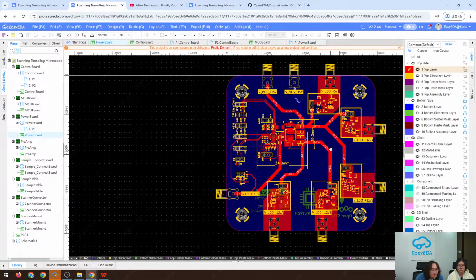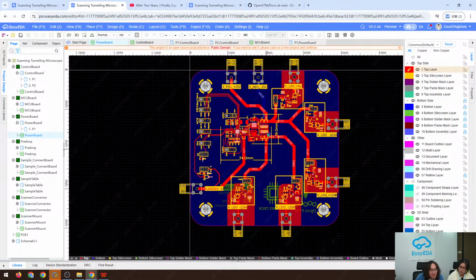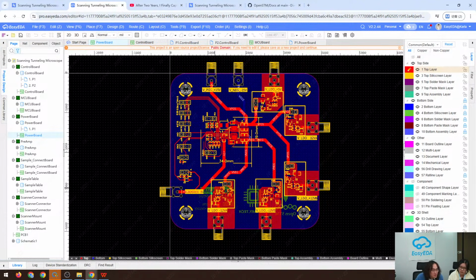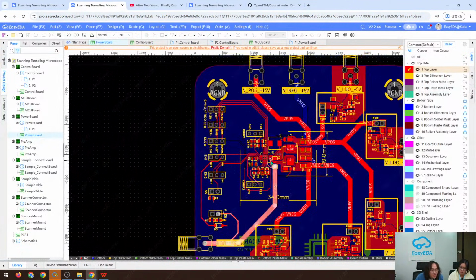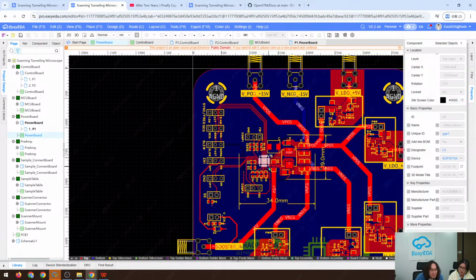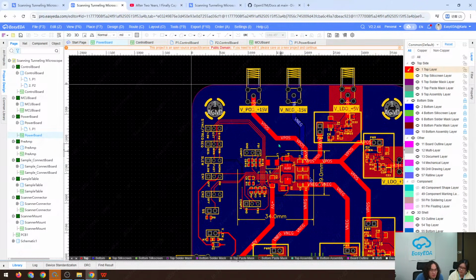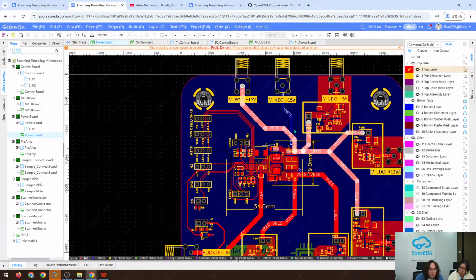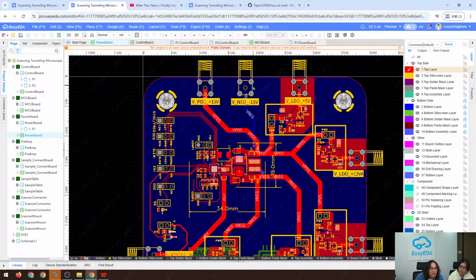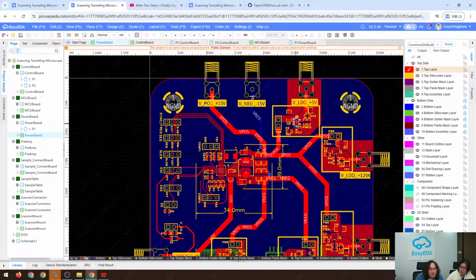The power board looks like this. The input of this power board is 5 volts, in our case just USB power, and we can see this is the power in, and this booster here is ADP5070. It converts the 5 volt input to positive and negative voltage, and then the positive and negative voltage goes through a low noise LDO.